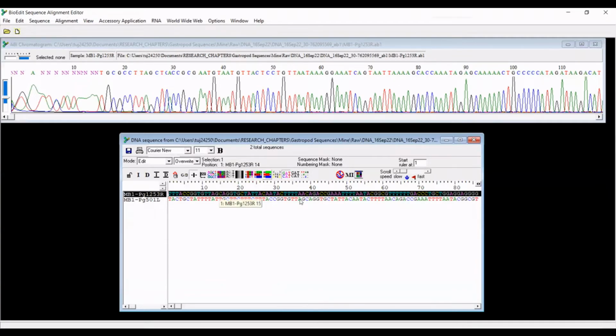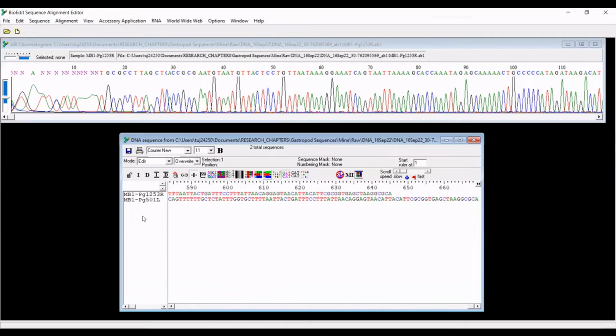It's not going to be, you'll notice, an exact match to the forward read right away because these sequences are not aligned with each other. That is going to be the next step that we do. Okay, so I'm going to save these sequences into a new cleaned folder. Again, never save these changes to the AB1 files. And I will resume the tutorial in just a minute here once I get everything set up.